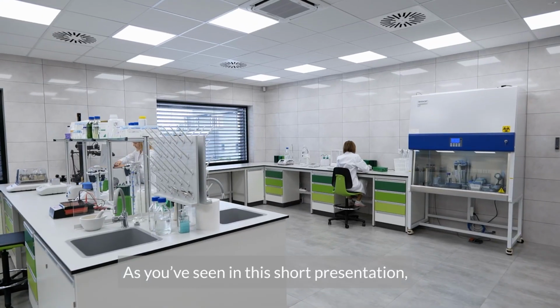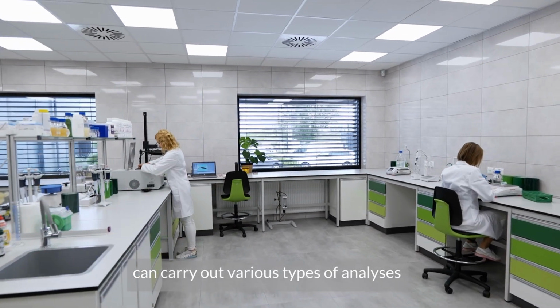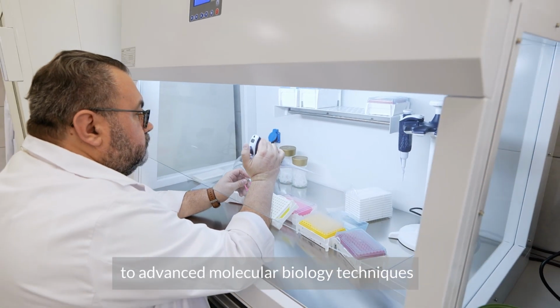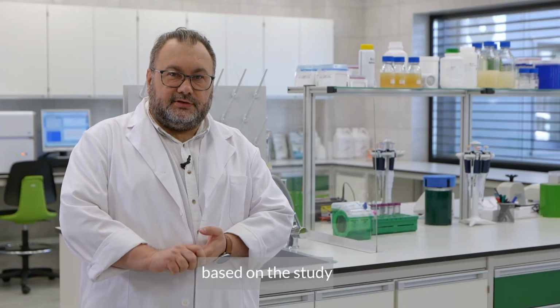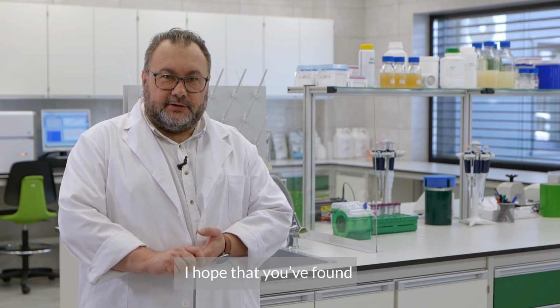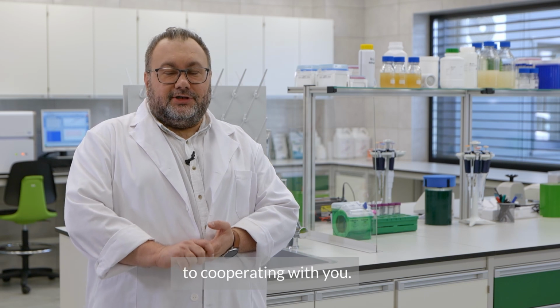As you've seen in this short presentation, our laboratory can carry out various types of analysis, from physiological and microbiological to advanced molecular biology techniques based on the study of nucleic acids. I hope that you've found our presentation interesting, and we're looking forward to cooperating with you.